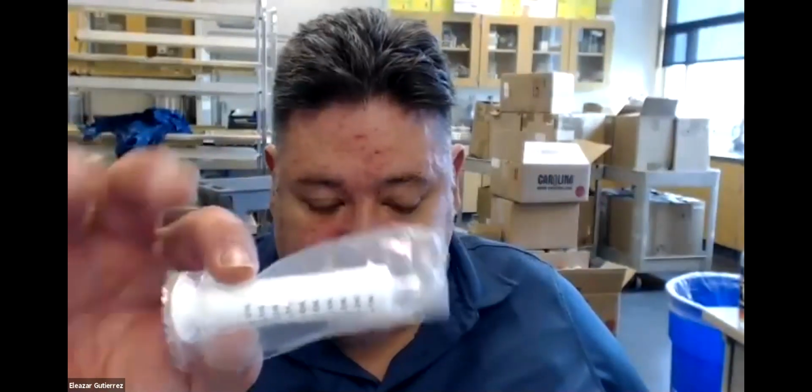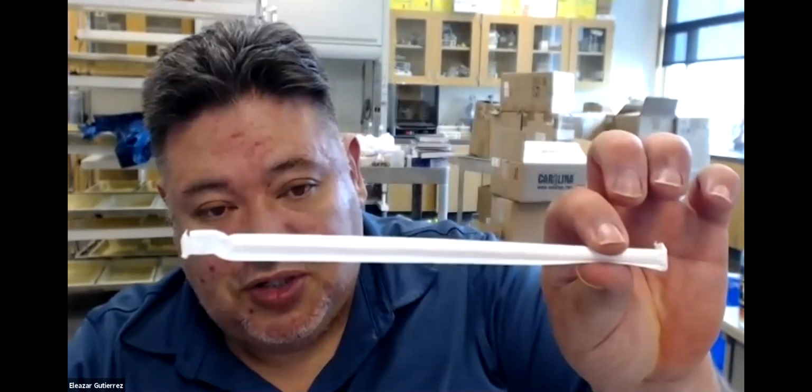No, actually, I'm lying to you. You have to take your syringes, right? And you're going to put 10 discs of spinach leaves in there because that's what's going to be carrying out the photosynthesis. You're going to make the discs with the straws that are provided. Okay. So I gave you straws. So do the math. You have 4 syringes. Each one takes 10 discs. So you're going to need 40. Make extra. Make 50 discs.